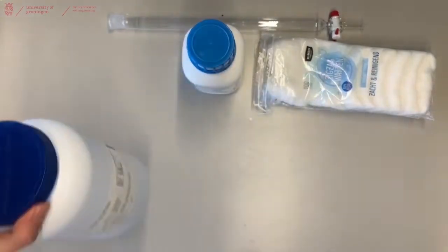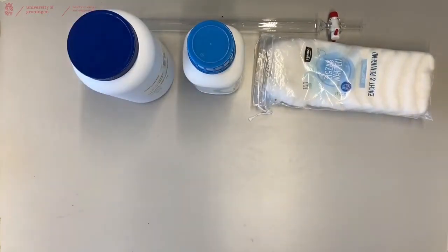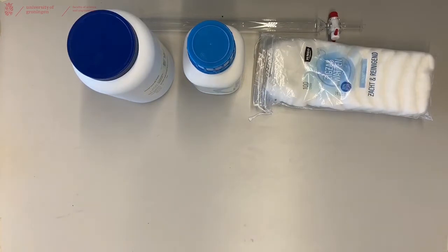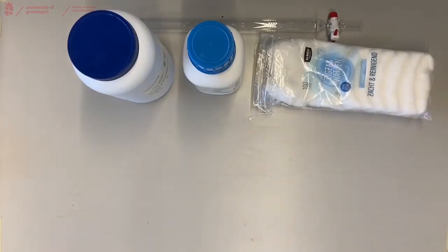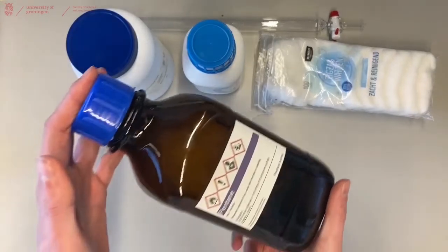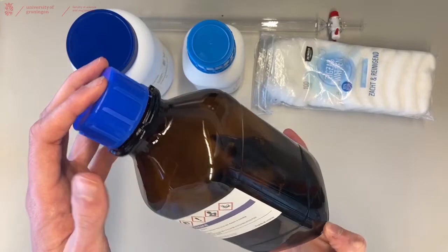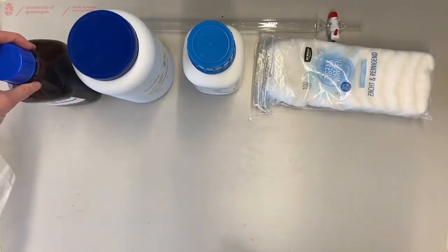You can also do alox columns. You will need to run the column with a solvent. You will have to decide which solvent you have to use or it's in your manual. In this case, solvents come in glass bottles. We use pentane and diethyl ether.